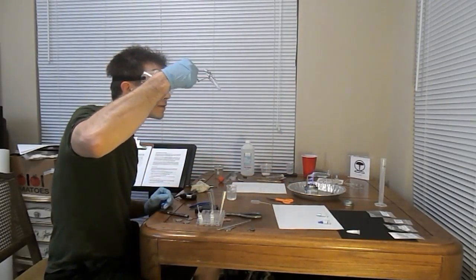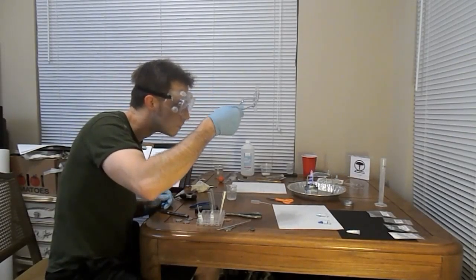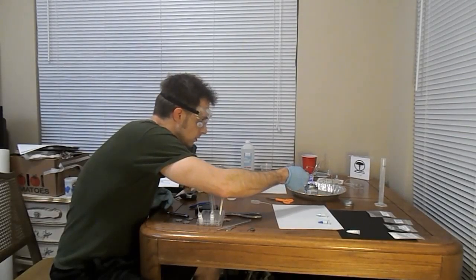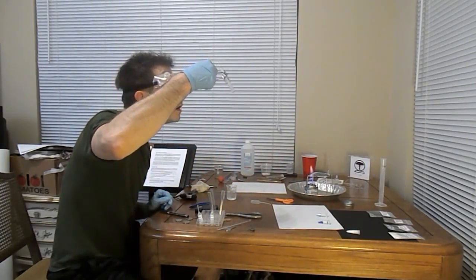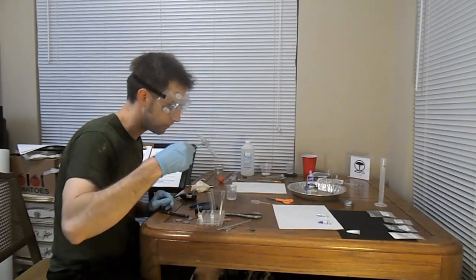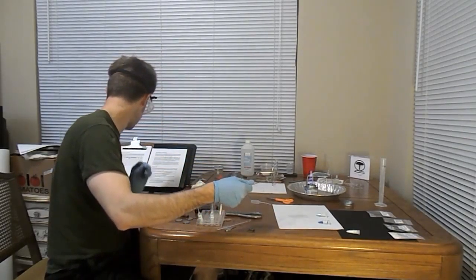Careful not to ignite this stuff because I'm not really equipped for that right now. Hopefully it would burn okay in this test tube. I have no idea. Pretty sure magnesium burns at, like, 800 degrees or something, or possibly even higher. And I'm not really observing any kind of change in this substance at this time.